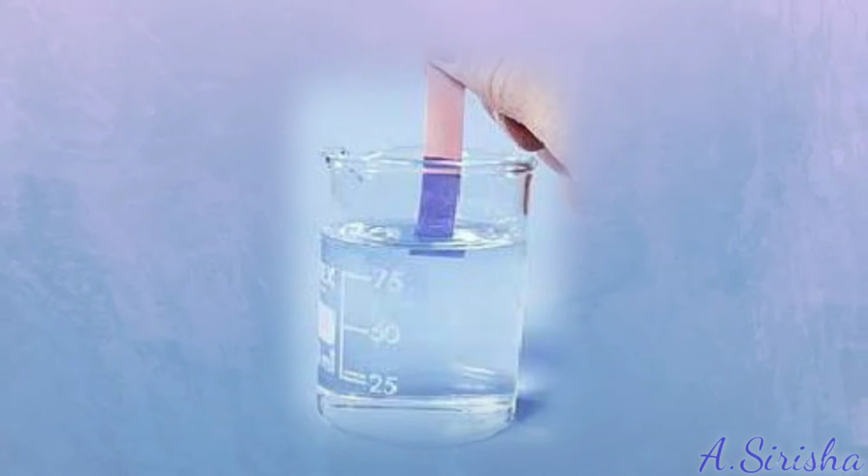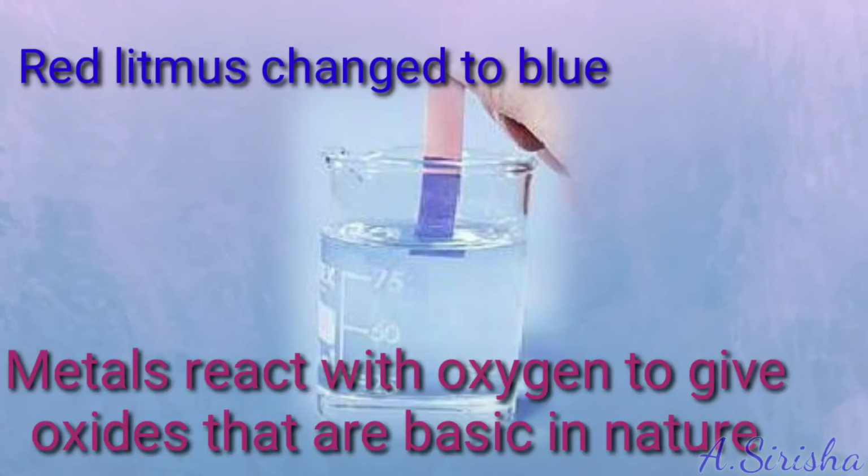Add some water to magnesium oxide and test with litmus paper. Red litmus paper changes to blue. Hence, metal oxides are basic in nature.